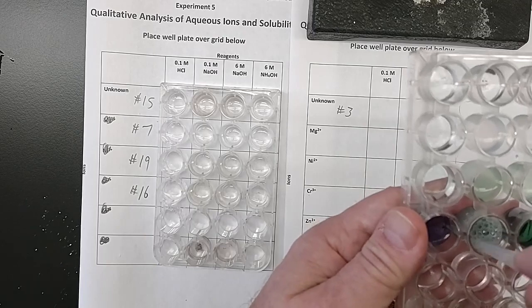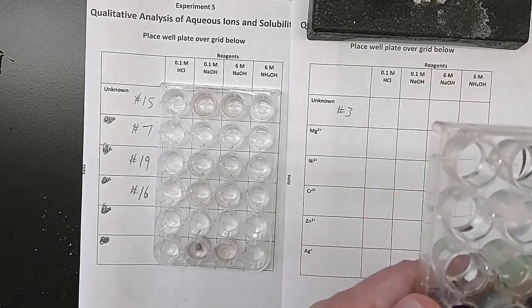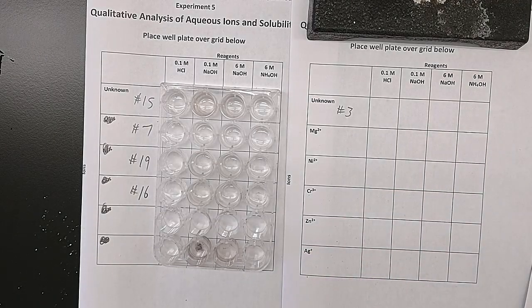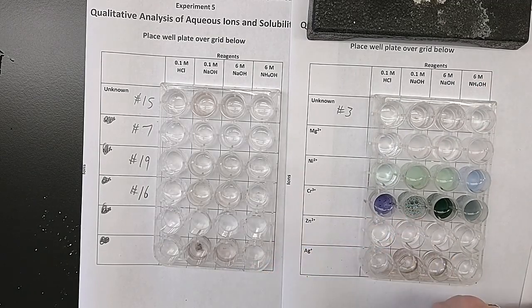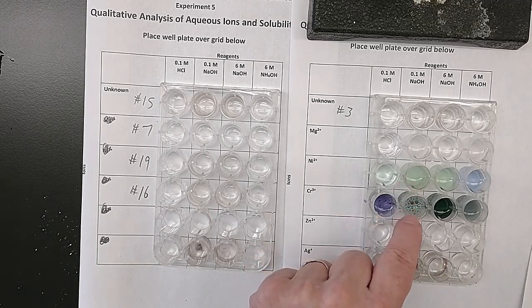This is lab science for you. Sometimes hard to tell what's going on. I'm gonna lift it up, and it won't be on camera. I'm gonna carefully, not spill it on my face, look at it from the side. This is cloudy but green. Okay, chromium plus a little bit of sodium hydroxide is cloudy and green. It is a darker green than the nickel, but it is definitely a green.